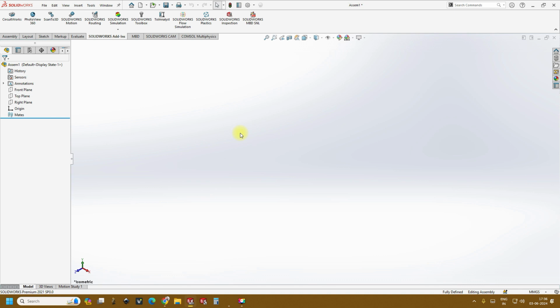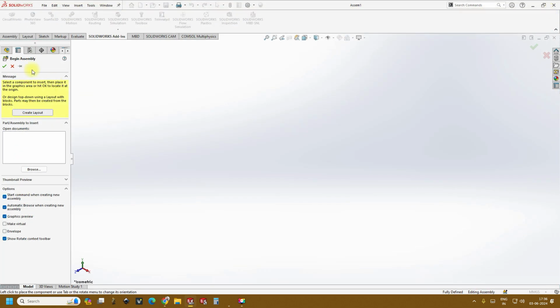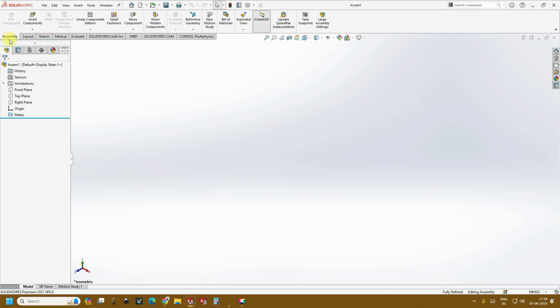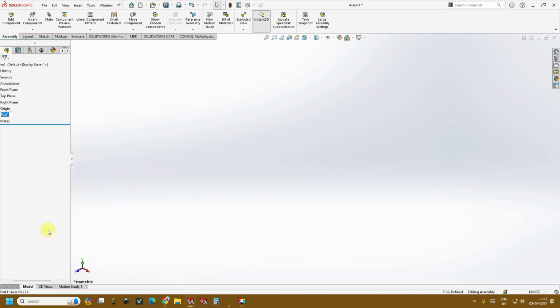Okay, so give some time to just get the assembly open. Once it opens, it pops up a new window to import the files, but just close it and go back to assembly, and instead of inserting components directly, just click below and create a new part, and we can rename this using the rename option over here and rename it as a base. So we write down Y channel base.